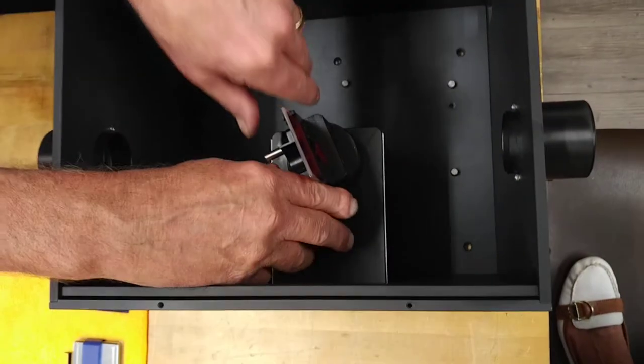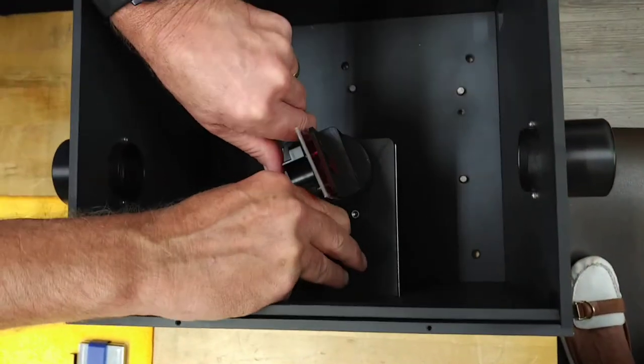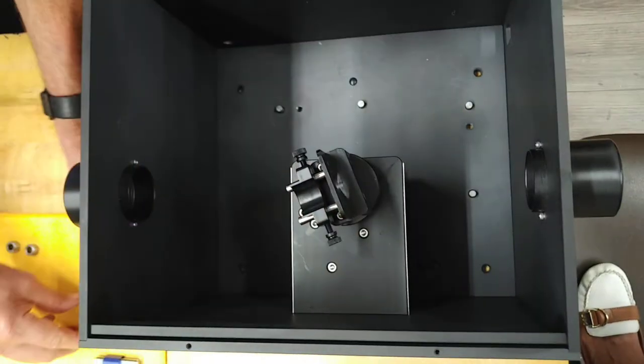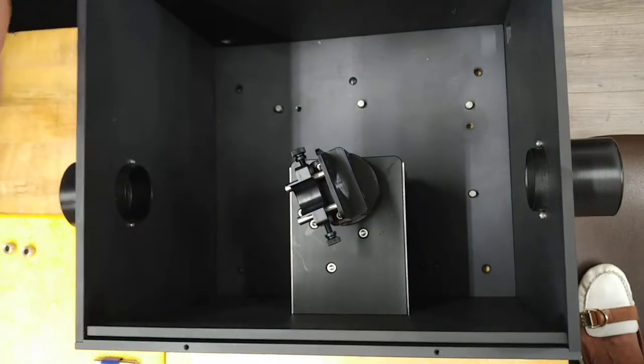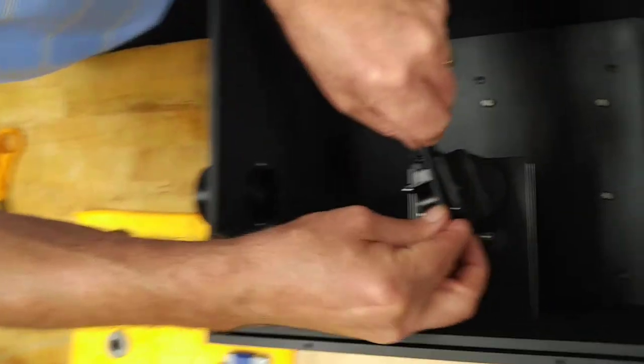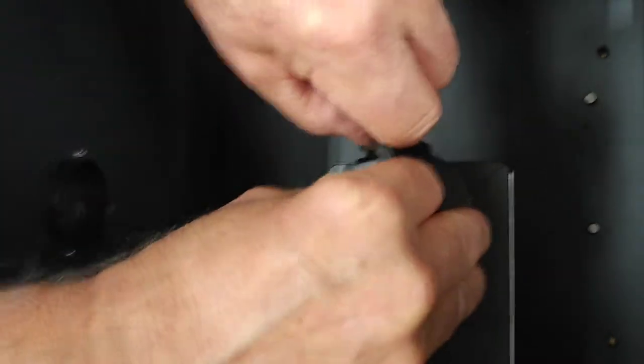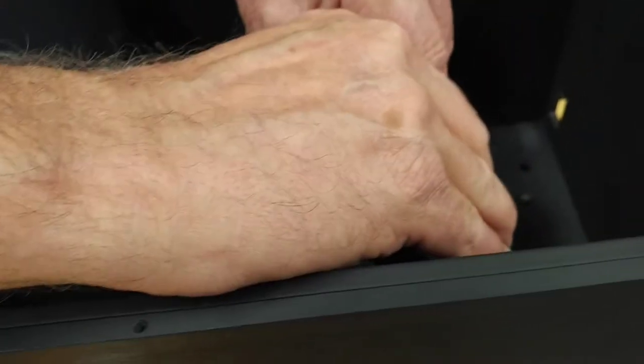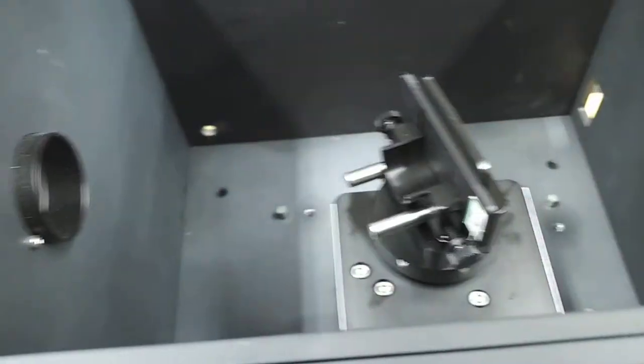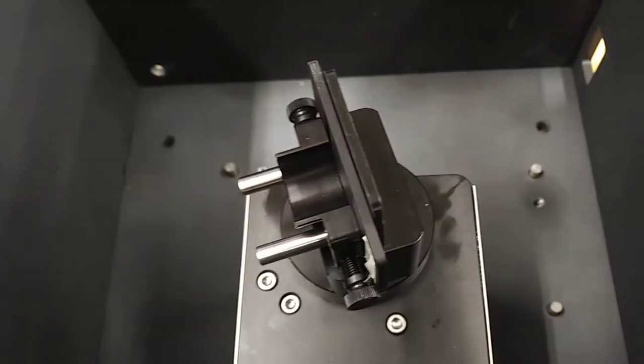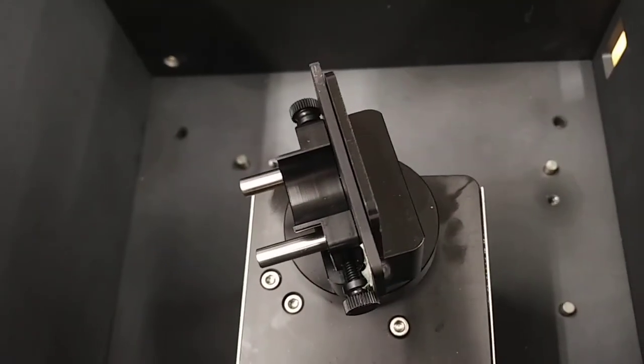All right, so now we'll try a second sample of a different dimension. In this case we have a much shorter sample that's slightly thicker, and that fits in quite nicely.